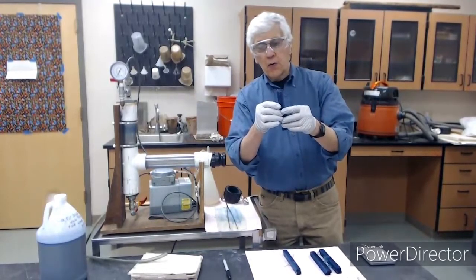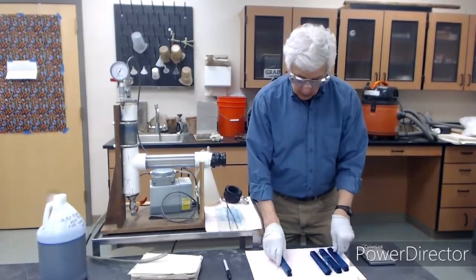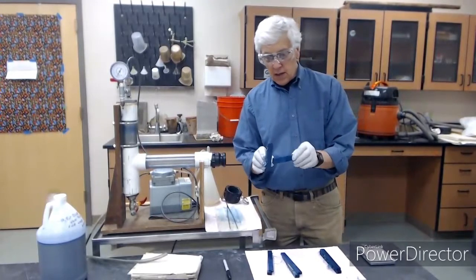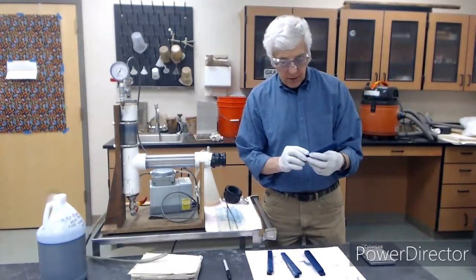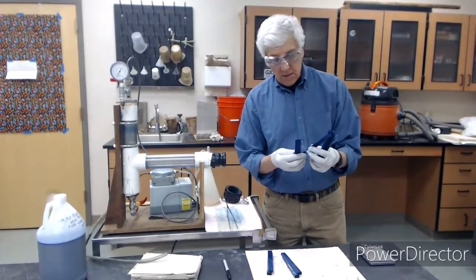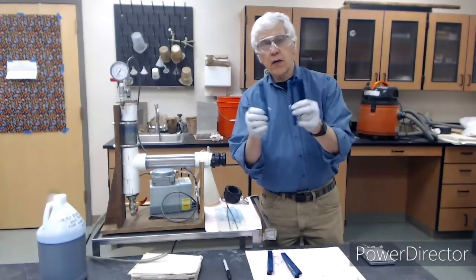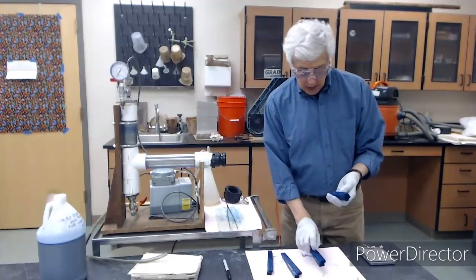All right, so what I will do now is the southern yellow pine I'm calling good, 100% penetration as far as I can tell. Except I don't even see the pitch pocket anymore. So stuff has diffused in there. There are areas that are lighter and areas that are darker, but all the areas that I can see are penetrated, and I'll be taking a close-up photo of this and including it in the lab folder.